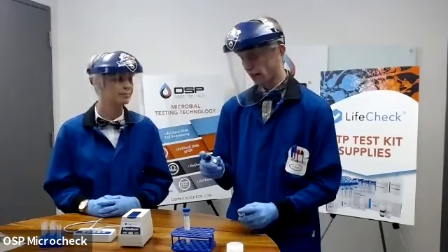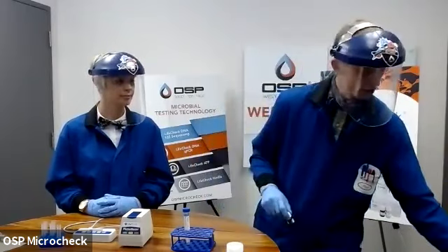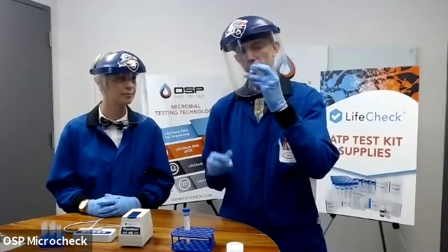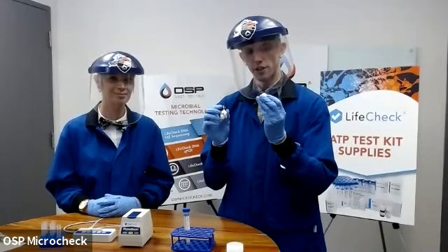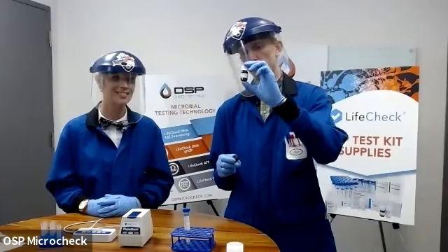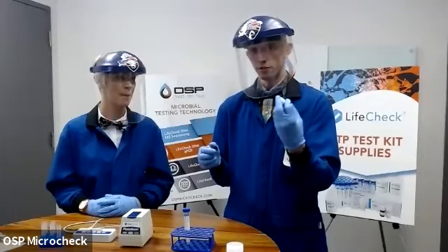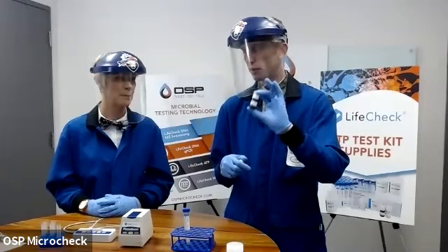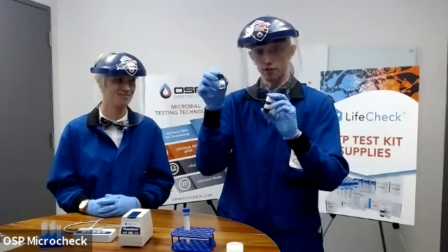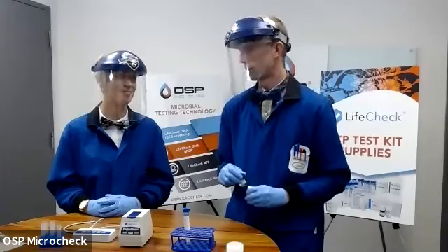Right. But prior to that, as in prior to having the ready-to-go enzyme in a bottle, it's actually shipped to you in what's called a lyophilized or freeze-dried form. So I have here 2 vials. This is how you would see your reagent Z on delivery. And we have the lyophilized version here. It's a white powder inside of an amber bottle. And this could be stored at room temperature, experience different temperatures as a whole, and be okay. So this guy, you don't have to worry about the heat, at least until you've added the buffer, literally pouring this into this one, activating your enzyme. And at that point, you need to be worried about its health.